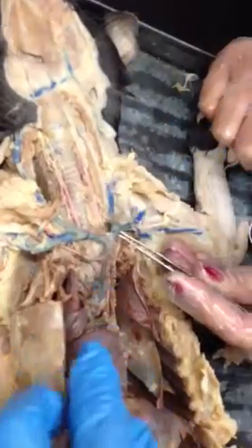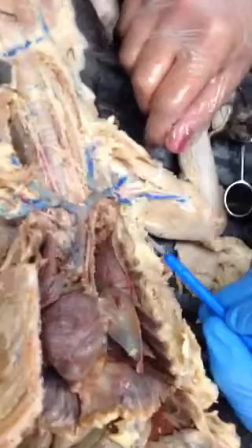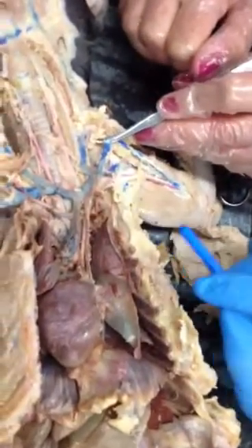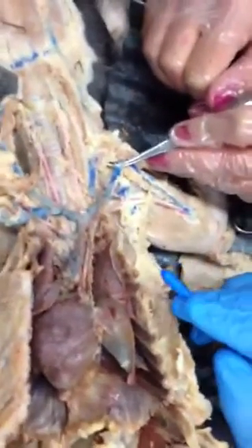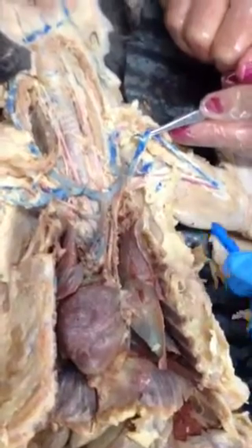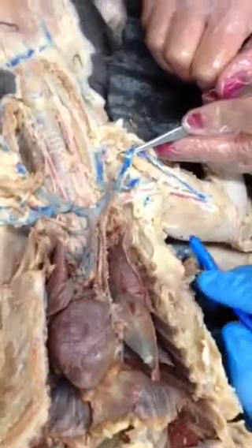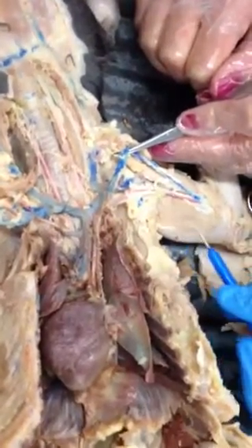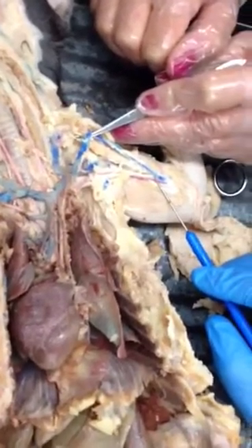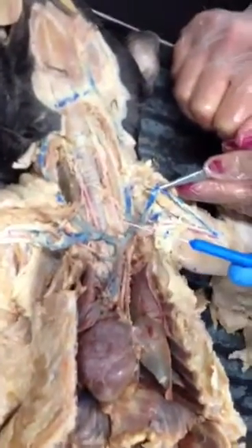Now, I know that Professor Miele talked to you guys about how the same artery or vein, depending on where it is, has different names. So this side will start out as your left subclavian. When it hits the axillary region, or the armpit, so to say, this would be the axillary artery. And then as it continues through the arm, it becomes the brachial artery. Make sense for everybody? Yep. So that takes care of really the top complex up here.